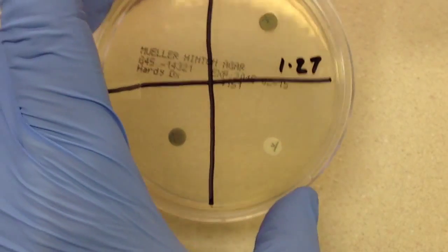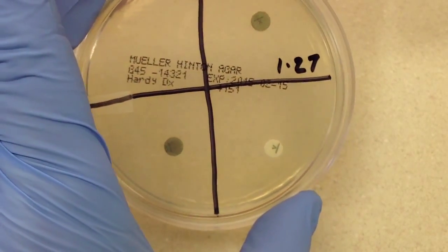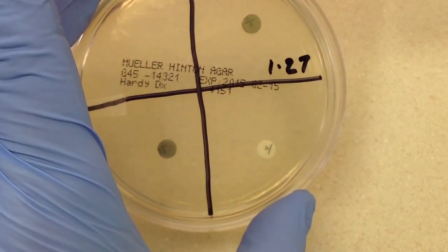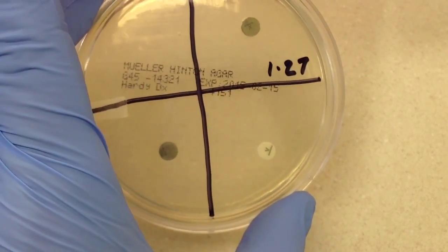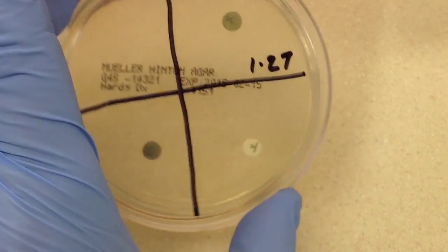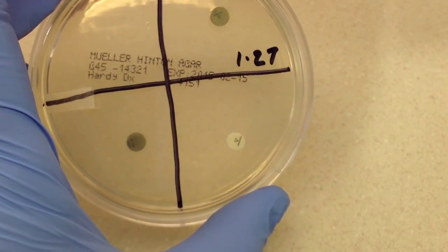Okay, so what we're going to do with this plate is we're going to incubate it at 37 degrees for, we'll check it in 24 hours. It'll be at 37 degrees in increased like around 5% CO2. So our student laboratory here is pretty low tech so we just use a candle jar.